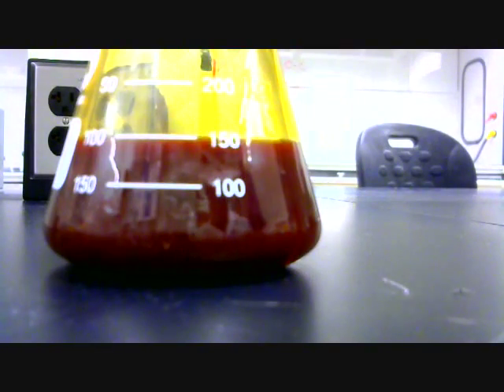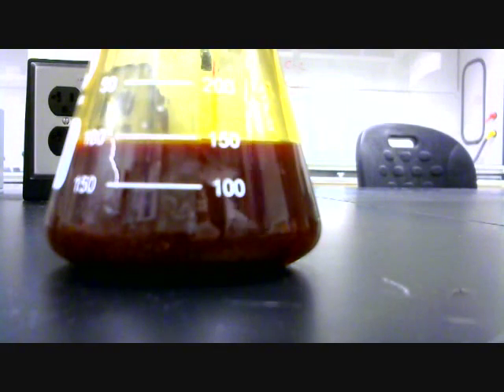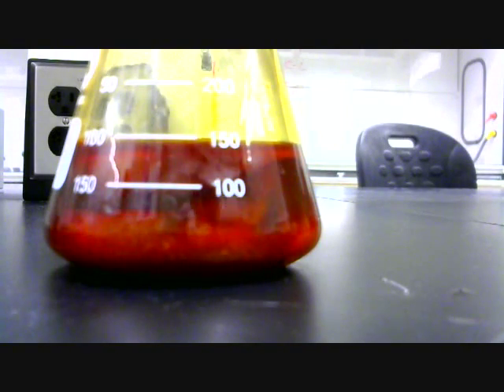I decided to edit out some of the process for time — the whole thing took about 4 minutes. You see the mixture gradually get lighter as a yellow precipitate starts forming. Eventually, the iodine color disappears entirely and a light yellow powder remains at the bottom.